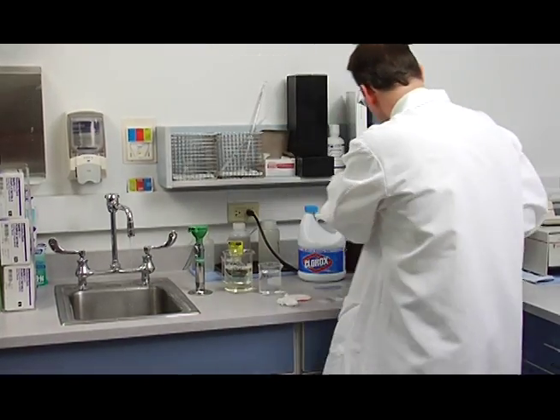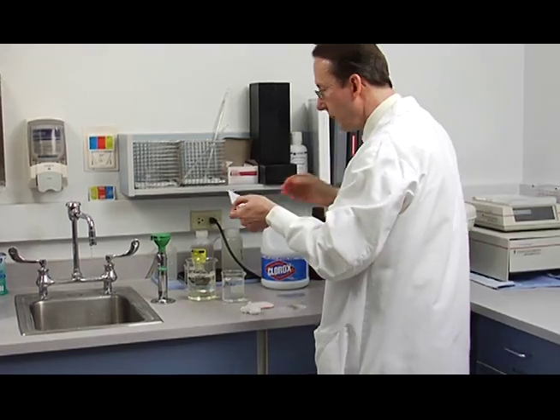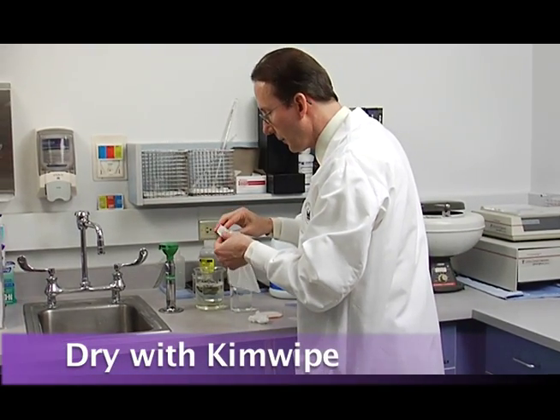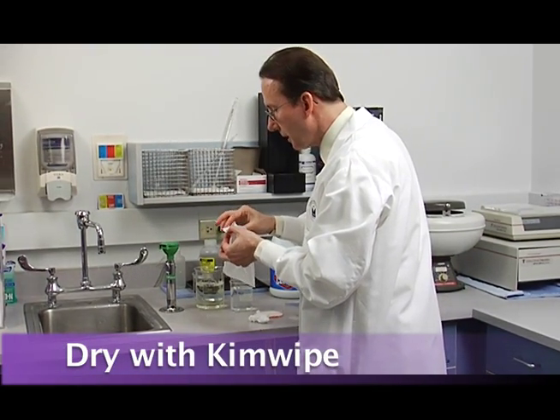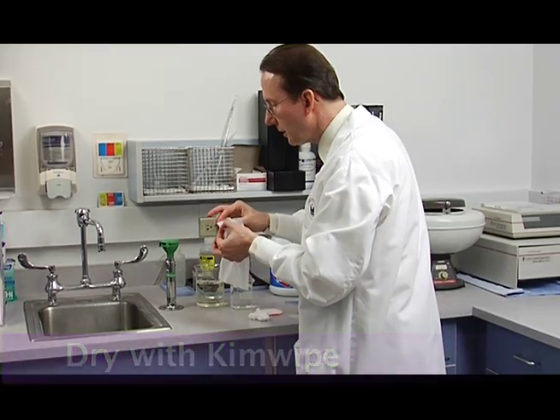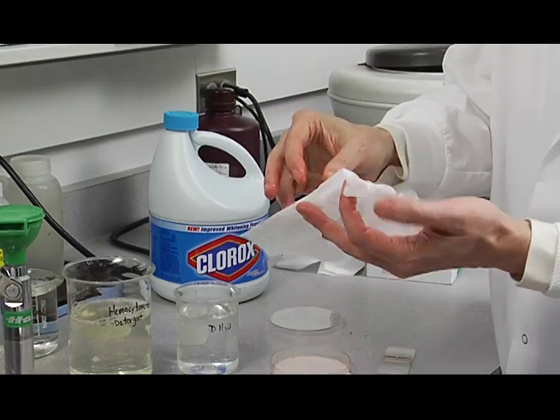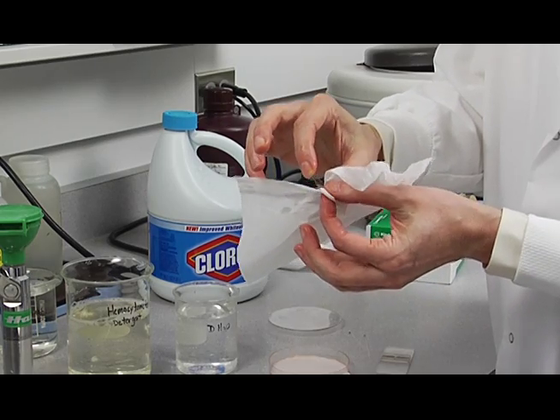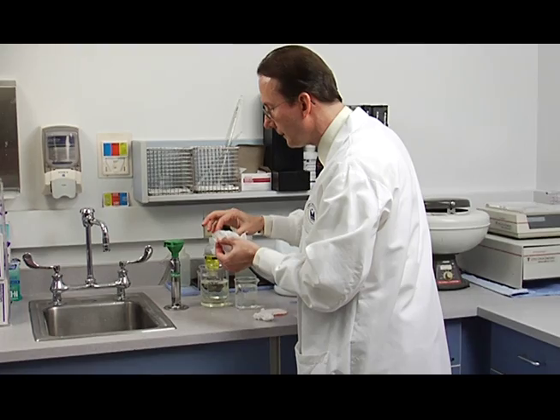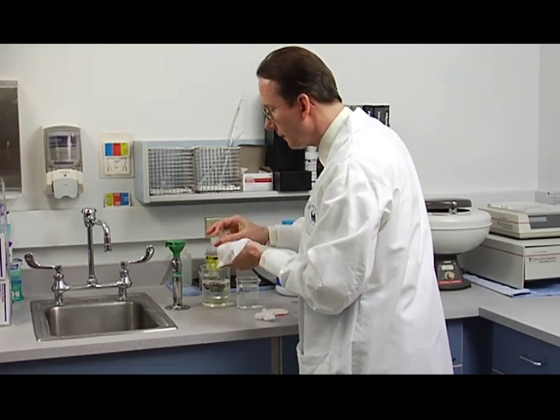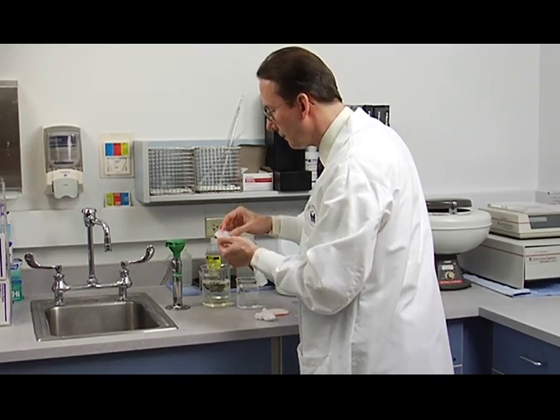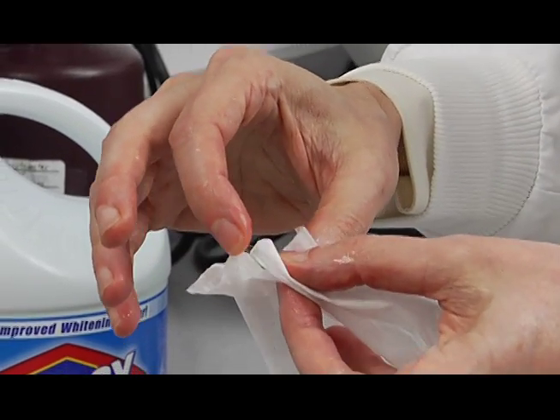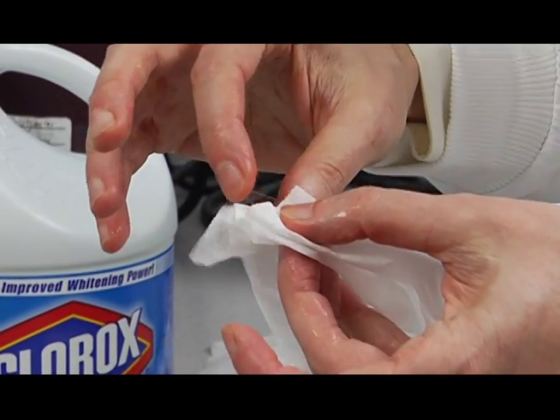Now we're going to take another lint-free Kimwipe, and we're just going to gently dry it in kind of a circular motion like this. And as it gets wet, we'll move it over to a dry area.